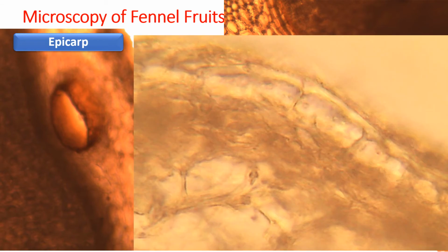The epicarp, since it is green tissue, will show the presence of some grooves or depressions at certain intervals. Now, this groove or depression is called stomata in certain books, because this is a green tissue and every green tissue performs photosynthesis. And for that reason, the stomata is present in this region. So you can see the stomata also at 40x magnification. That means 400x magnification by using 40x objective and 10x eyepiece.